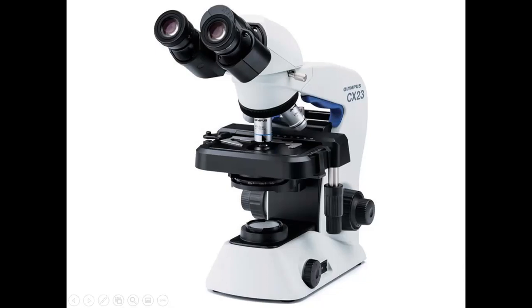These are called the revolving nose piece, where you've got your magnification lenses on here. And this particular one has 4 lenses, and you can actually turn these to get the different magnifications. So I'll talk all about that. You've got on the right here, this big round knob is your coarse focus, and on the inside of that knob, sticking out here, is your fine focus. So you always want to use your coarse focus when you're first bringing your specimen in focus, and then finally adjust that with this fine focus knob.